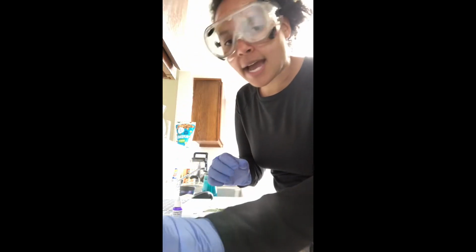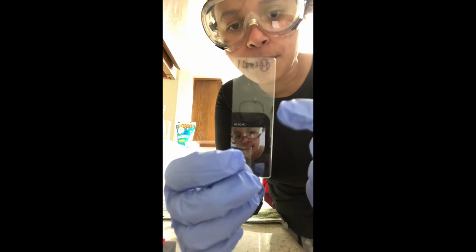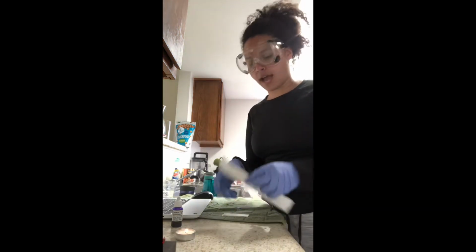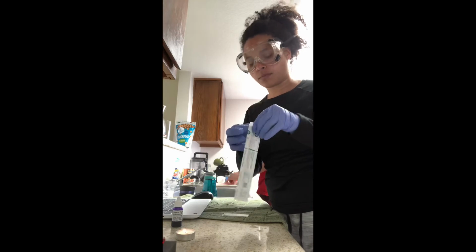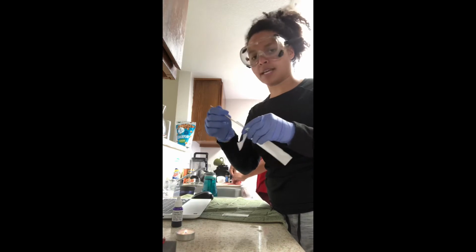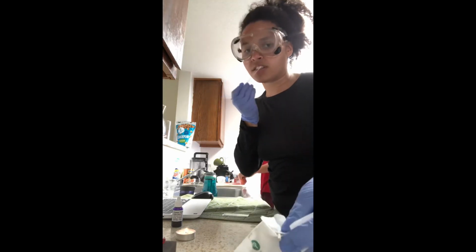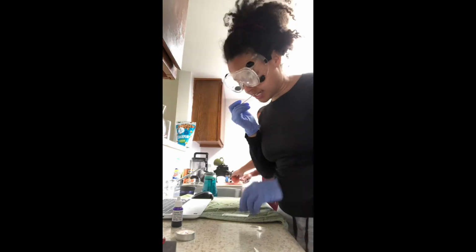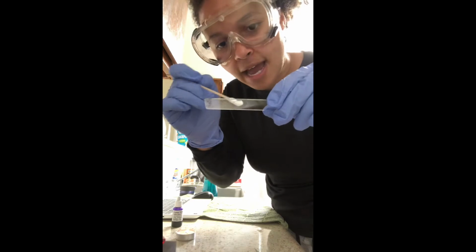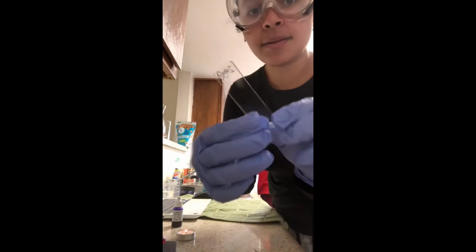On this first slide, I indicate that 1 is the first slide, direct is the sample of direct stains, and M indicates the sample will be from the mouth. So with this one, I will collect my sterile swab, and I will vigorously scrape the inside of my gums and teeth. And then with the swab, I will place it in a circular motion. And then once I'm done with that, I will let it air dry.